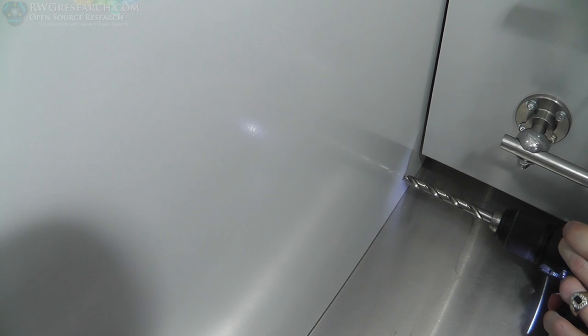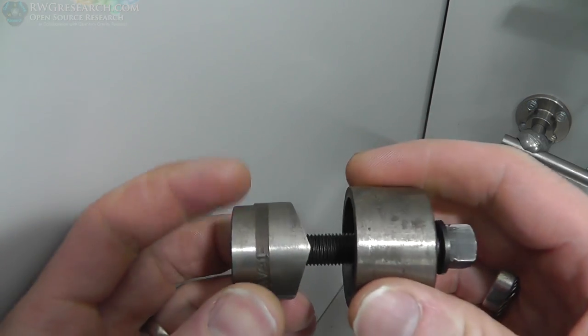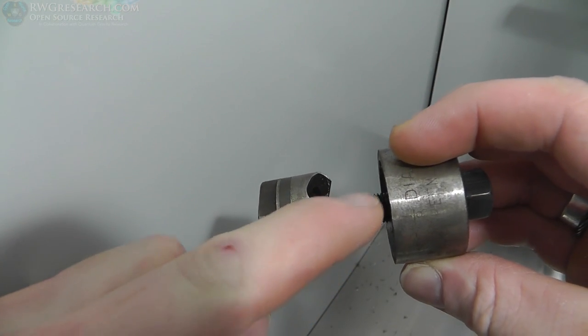First things first, we're gonna drill a hole. So I'm gonna drill it about right here. I could use a punch for this, but we'll stick with this. Oh, what a mess. All right, so we drilled a hole. Next thing we're gonna do is use the punch. Now, the most important thing is make sure you put oil, mainly on the thread, but you can put a little bit on the cutter if you really want to.